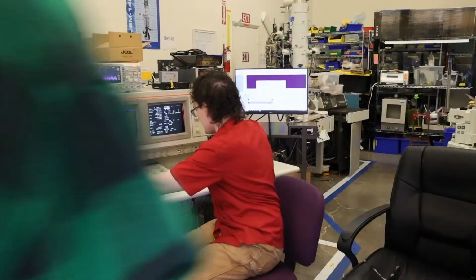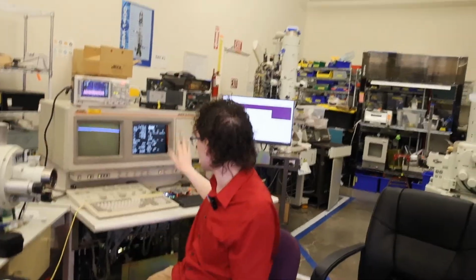So do you want to grab the R6 and we'll start working on plugging in the cables behind the microscope for this? Sure. So now that we've got the software running, we're going to go behind the microscope and start plugging in some cables to the external scan interface. And then we're going to come back here and plug cables back into OBI and start going.